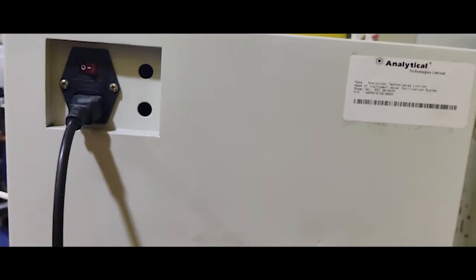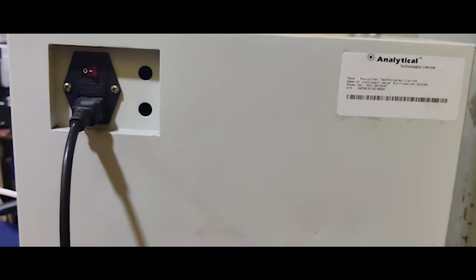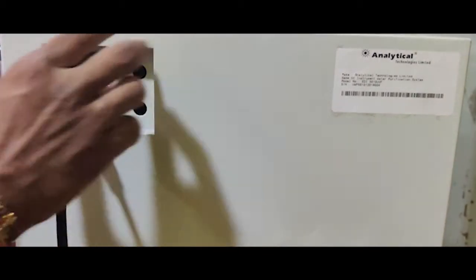After the tubing connection, we will power on here.